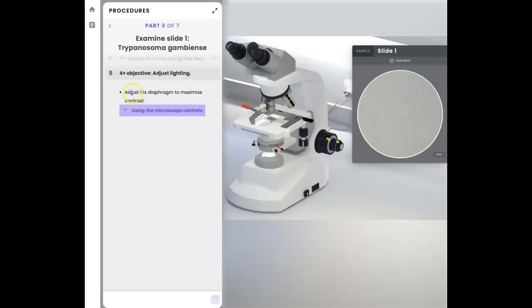And according to the instructions, what we need to do is adjust the iris diaphragm to maximize contrast. Now that is down here and is this lever. So once again, I'm going to be watching this word contrast until a check mark shows up, because that's what the simulation wants you to do. Okay, so here we go. Sliding it in one direction, more light is coming in, and all of a sudden right there I see the check mark. Let me see if I can go past that to make it more bright. Yes, so the check mark disappears and is maybe not as sharp. I don't see a big difference, but again, because this is a simulation, we just need to go until you see that contrast check mark.